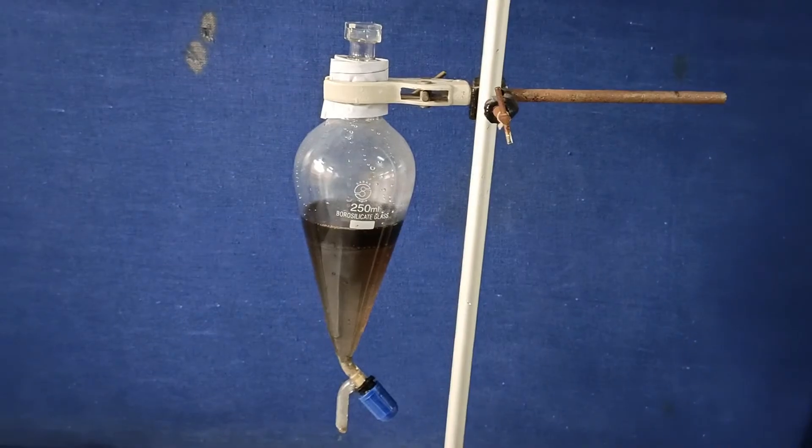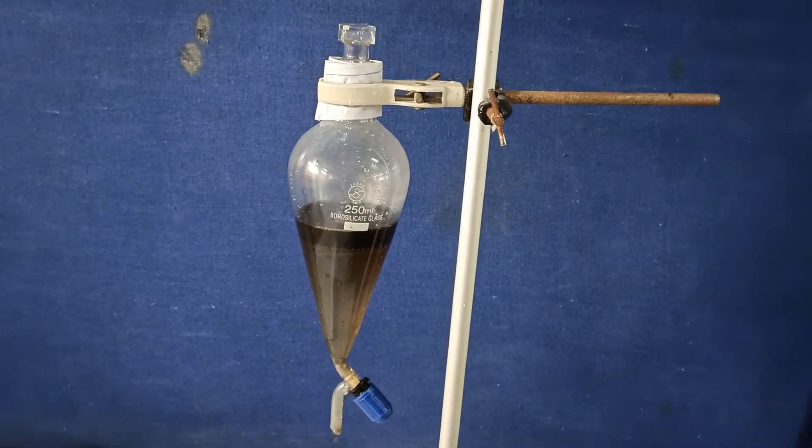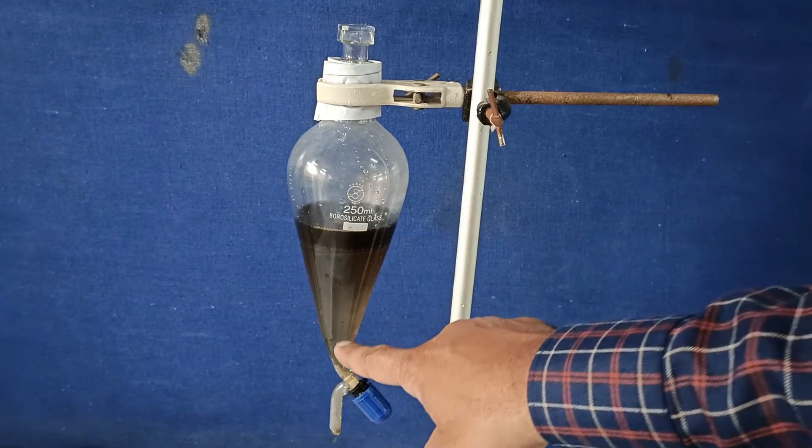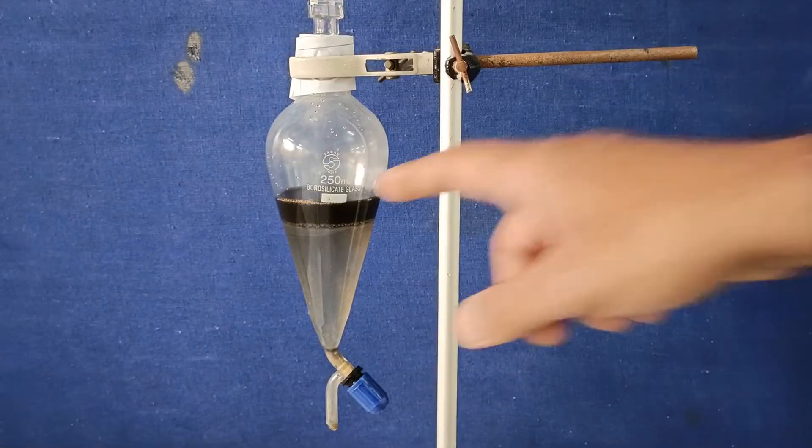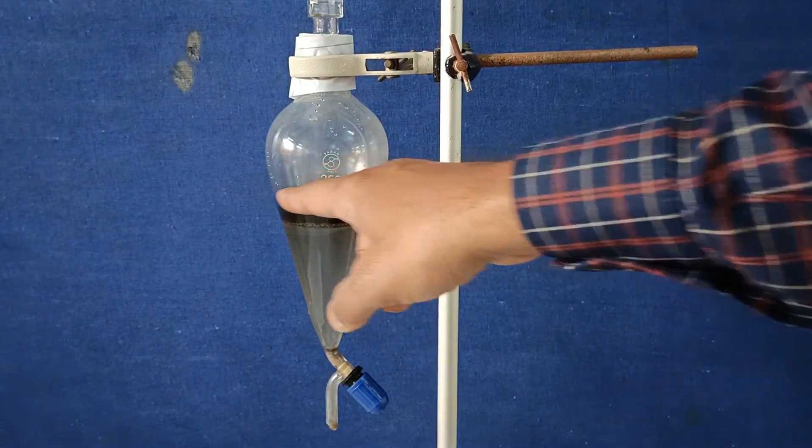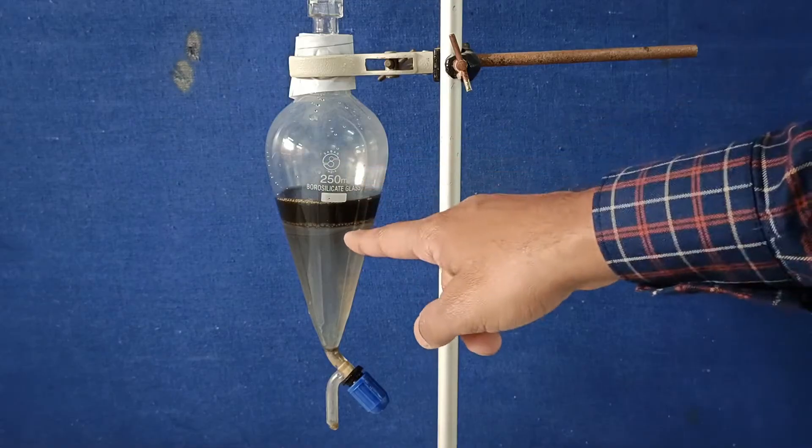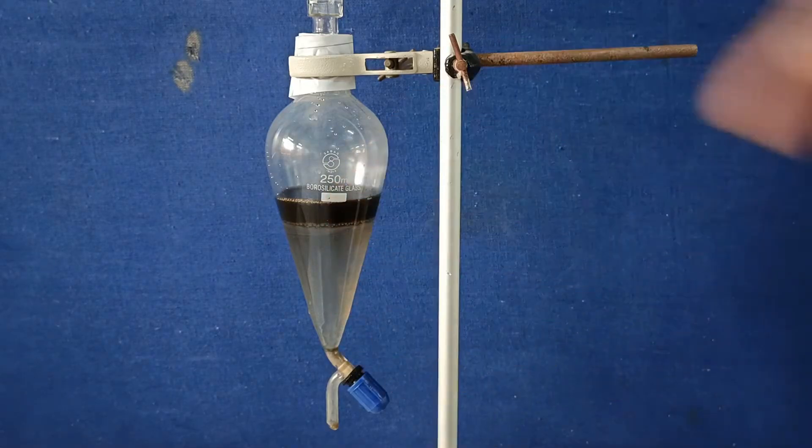We would expect the oil to settle at the top and water at the bottom. After 15 minutes, the lighter liquid oil floats at the top of the water. Separation took place due to difference in densities.